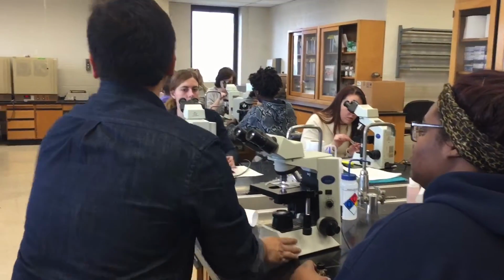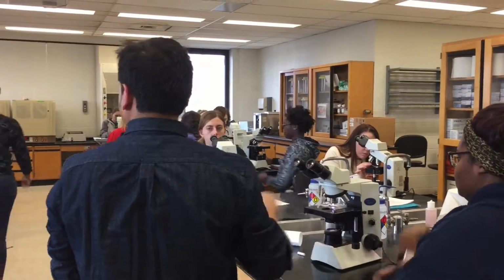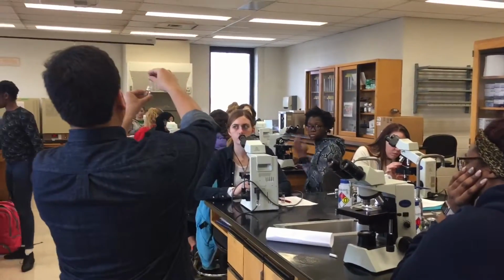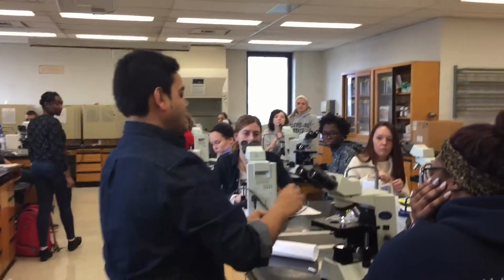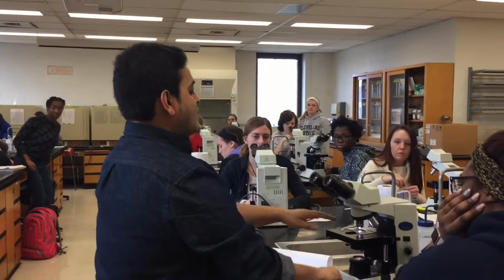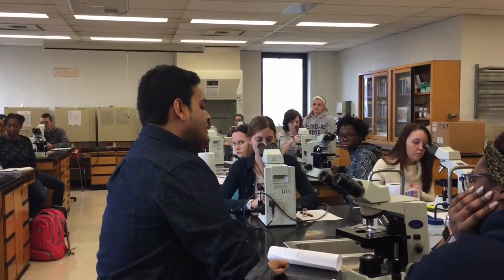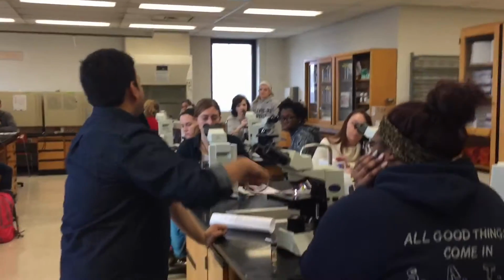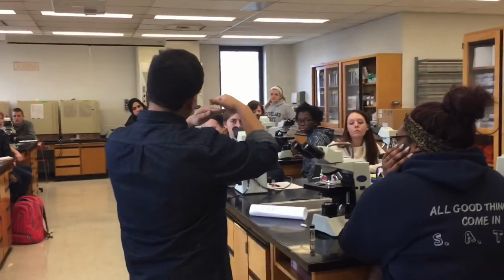Okay guys, if you want to gather real quick, I'll be more than happy to show you the stuff. So first I take the oil bottle and put one drop on the top of the slide. Just one drop, that's it. Now I was looking at 10x, now I'm going to move to 100x. I'm not going to move this way because the 40x is there on the right. The 40x lens is also pretty low.